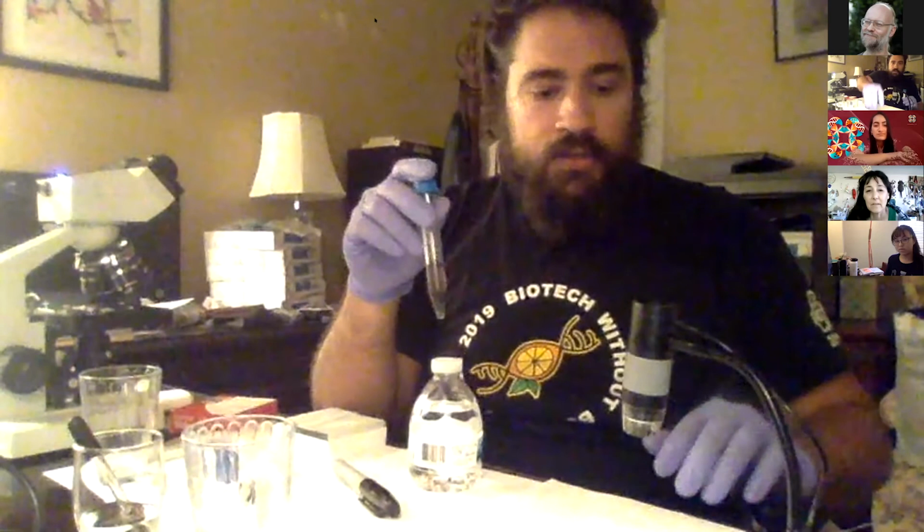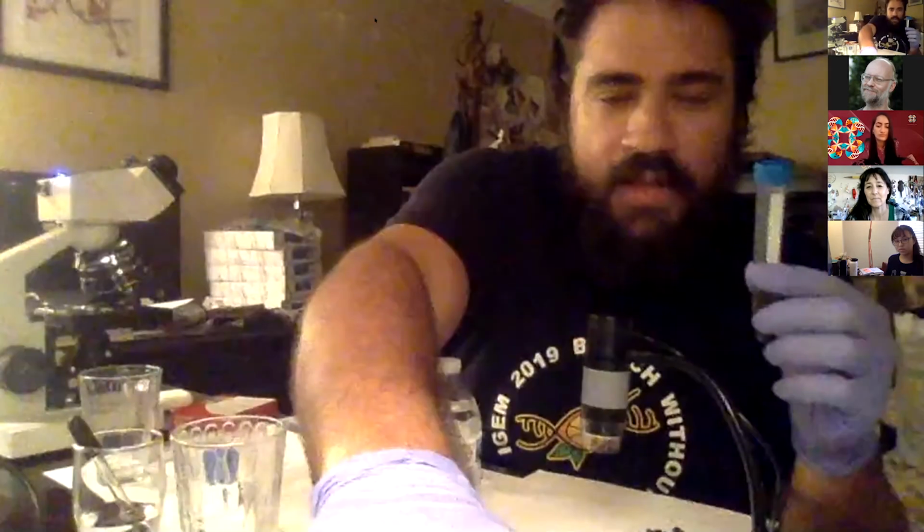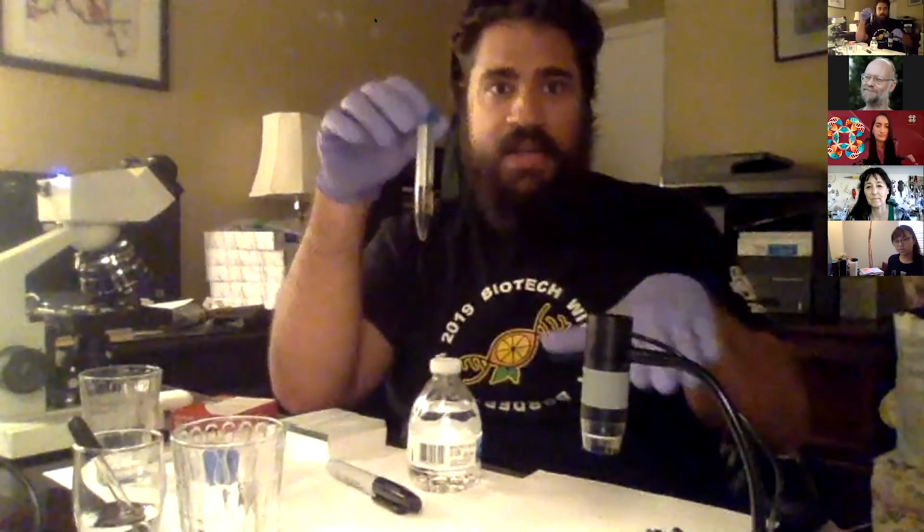And what I'll do is I'll switch back over to my little dissection camera. Little microscope slide over there. Cool. And so that's all set up. So we looking at me? Okay, cool. So now it's in position.